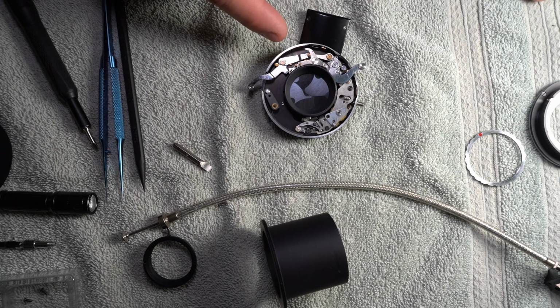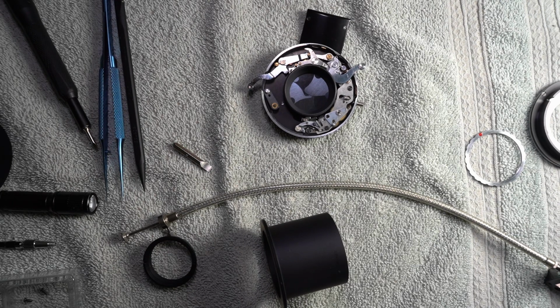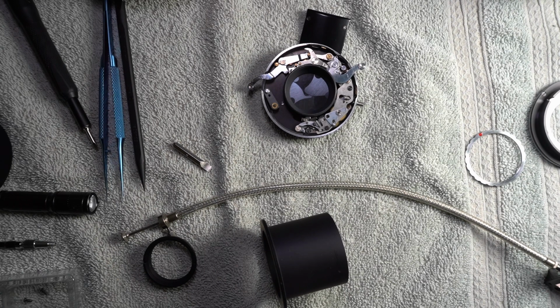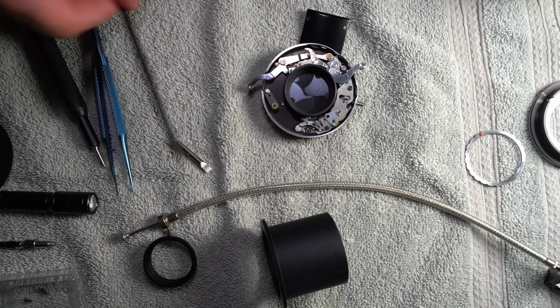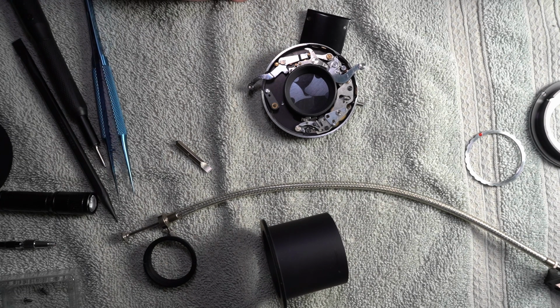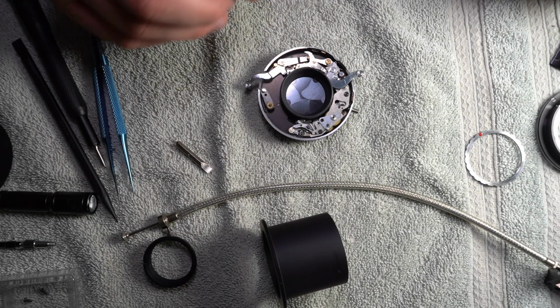If I was going to do that, I would probably take this down to a jeweler that does watches, or a watchmaker or something like that. I would do research on it to be sure this guy really knows what he's doing, because this is a very rare and kind of expensive part. I got it for $80. I've seen them for as much as 500. The fact that I got this one in almost mint condition, I don't think it's got a scratch on it. Really nice quality piece. I mean, it's Nikon, it should be.